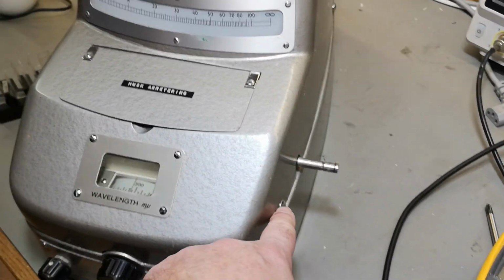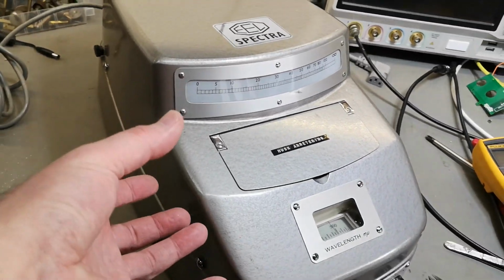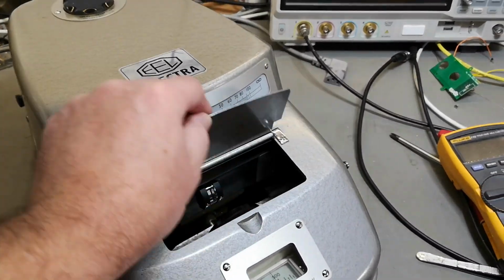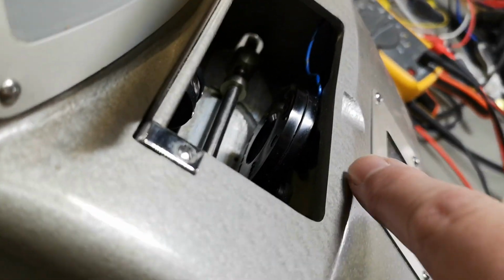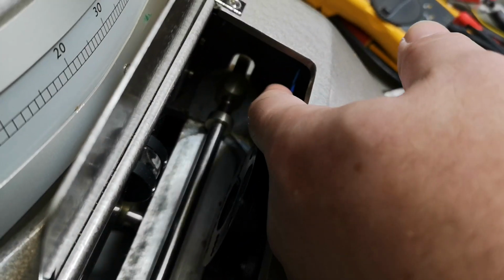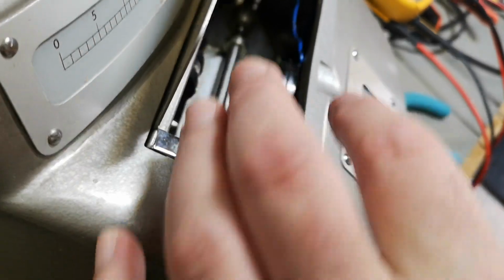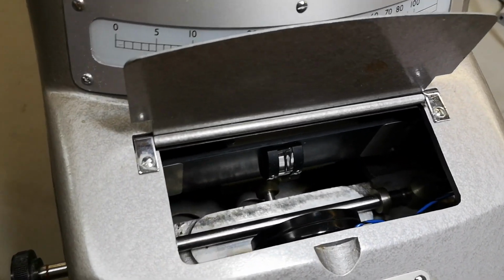We got some screws, 2 screws each side. So I think I will be able to lift up the top. It looks like nothing is connected other than the... Okay, this part, we got some wires that's probably coming, or it's probably staying down there. Oh yeah, look at that cool detail.